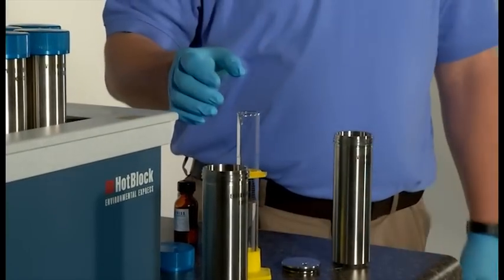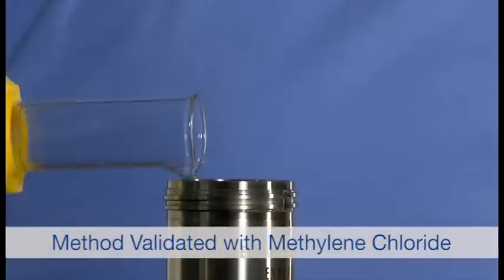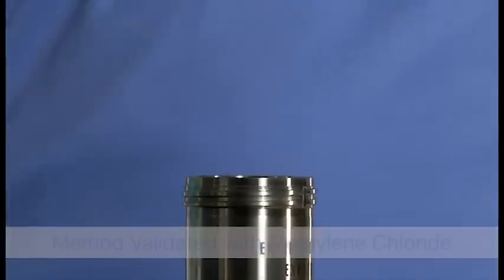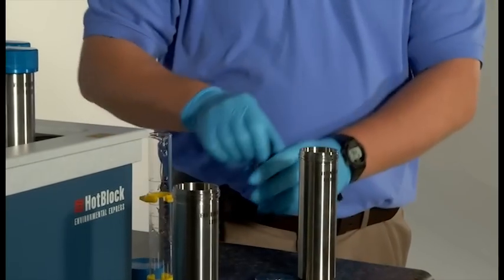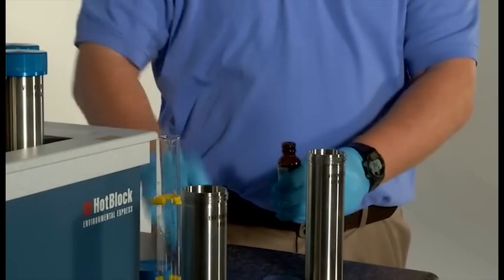Next, add 30 mils of the appropriate solvent. Add any surrogates or standards that are required by the determinative method.